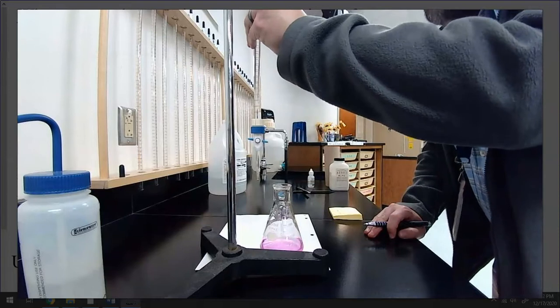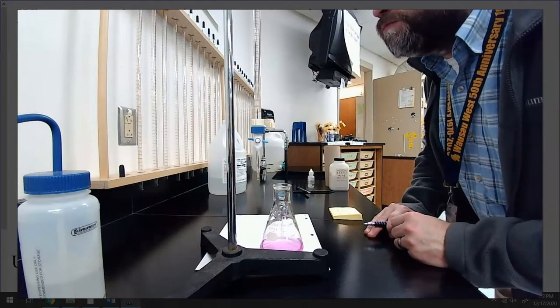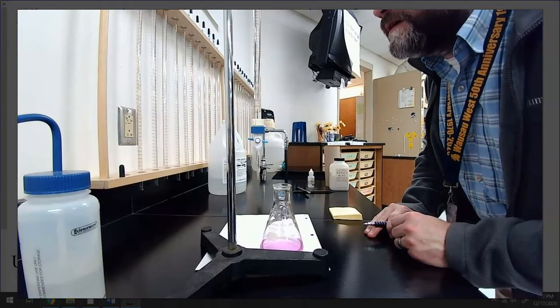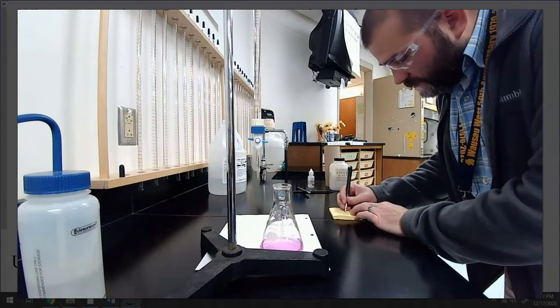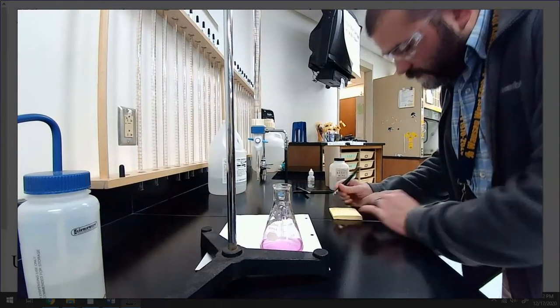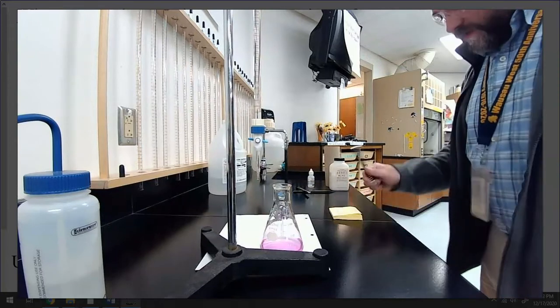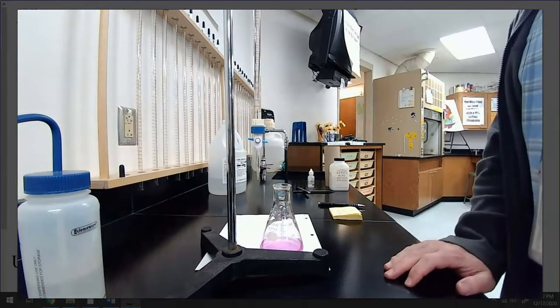I started at 16.52, and I have ended at 29.39. Yep, perfect. Sweet. So, I'll get you all that data for A.